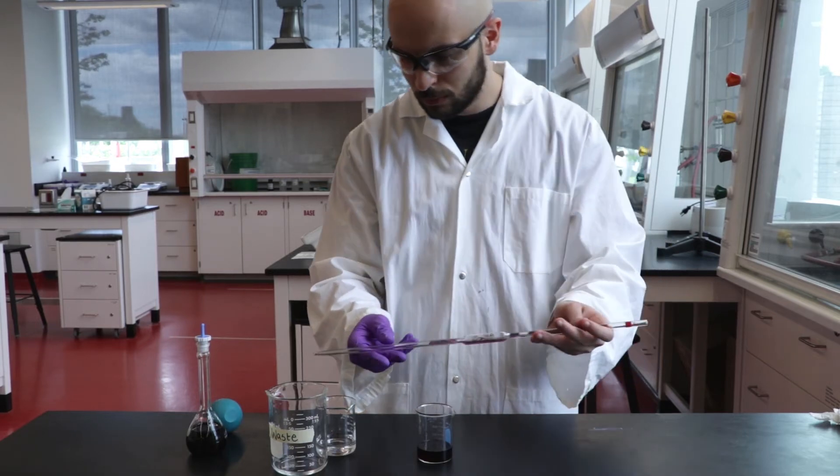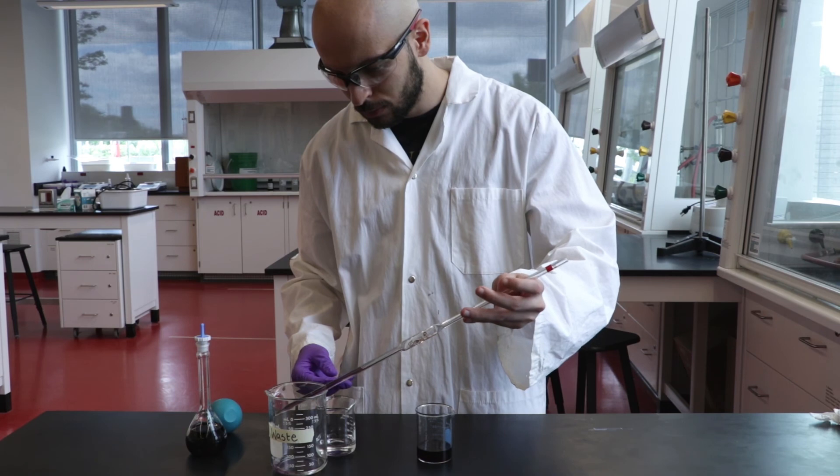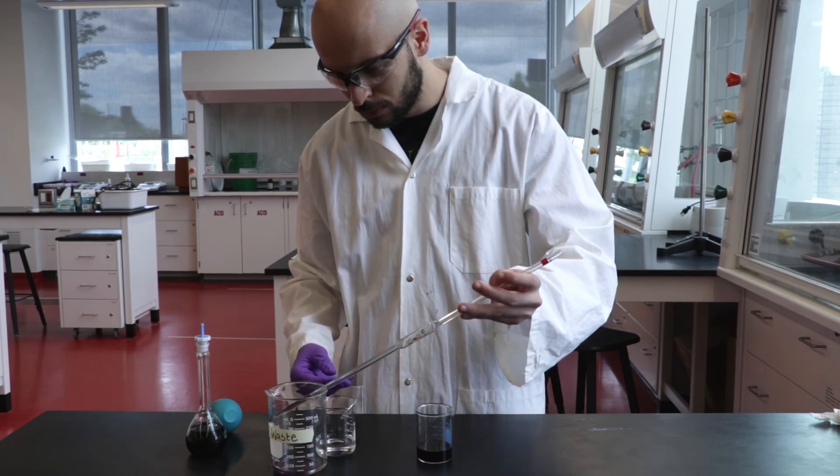Do not dump liquid out from the top of the pipette, rather let it drain out through the tip only. This pipette is now clean and coated and ready for use.